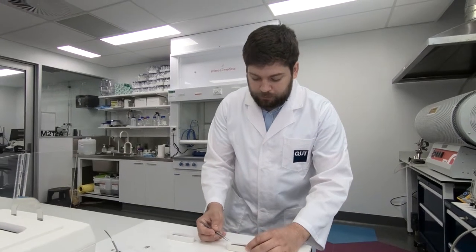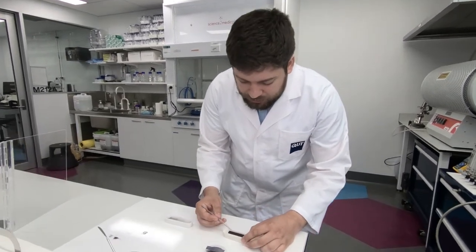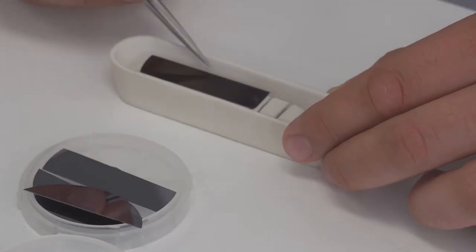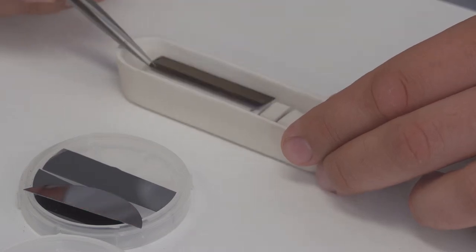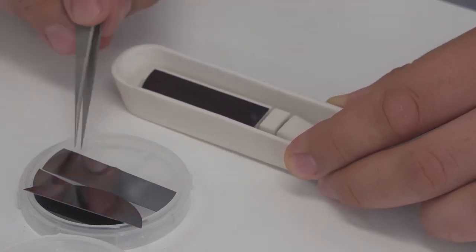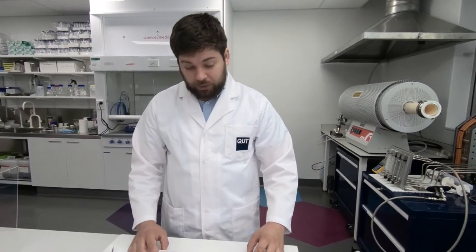And if you look on our silicon substrate, you can see that its color changed a lot compared to the initial silicon wafer. And it means that we have nanostructured coating on its surface. So now our experiment is finished. And I hope it was interesting and you understand a lot about basics of CVD synthesis.